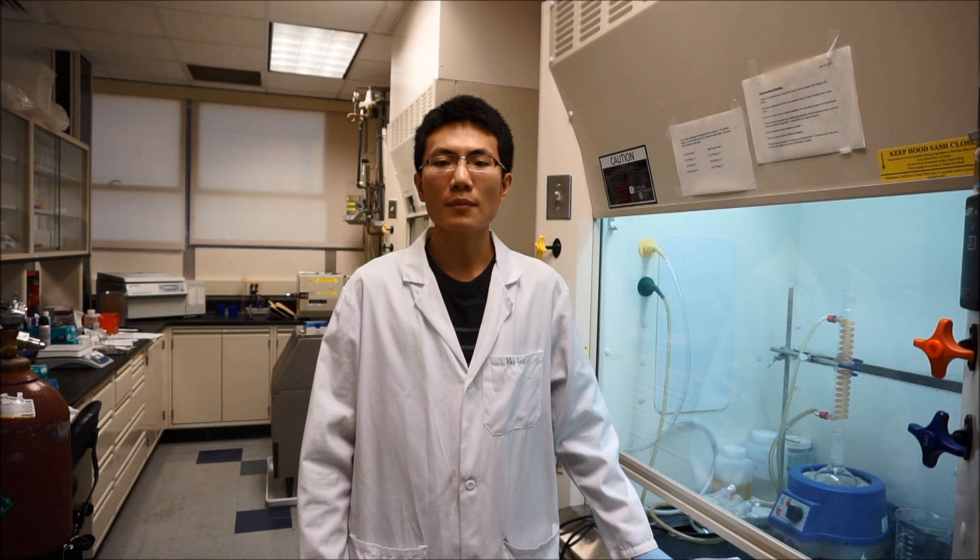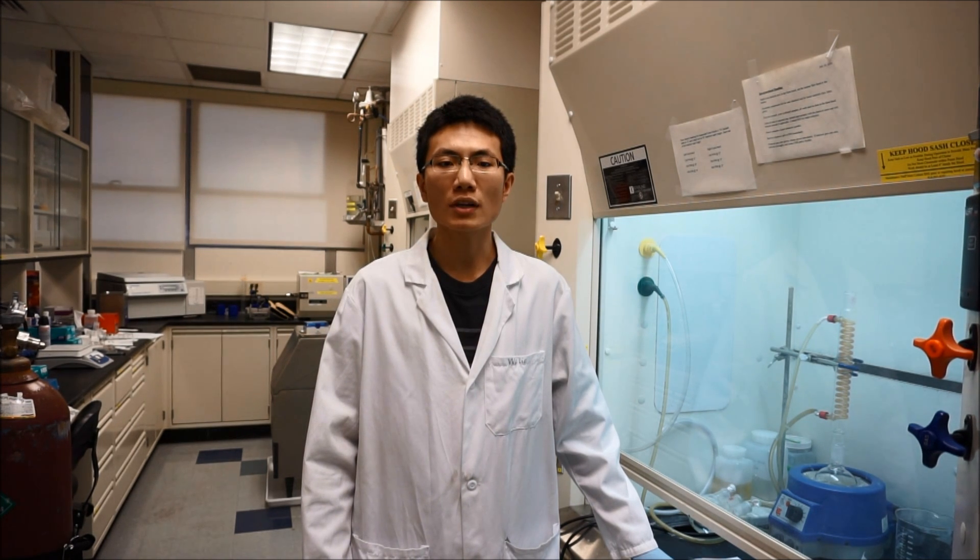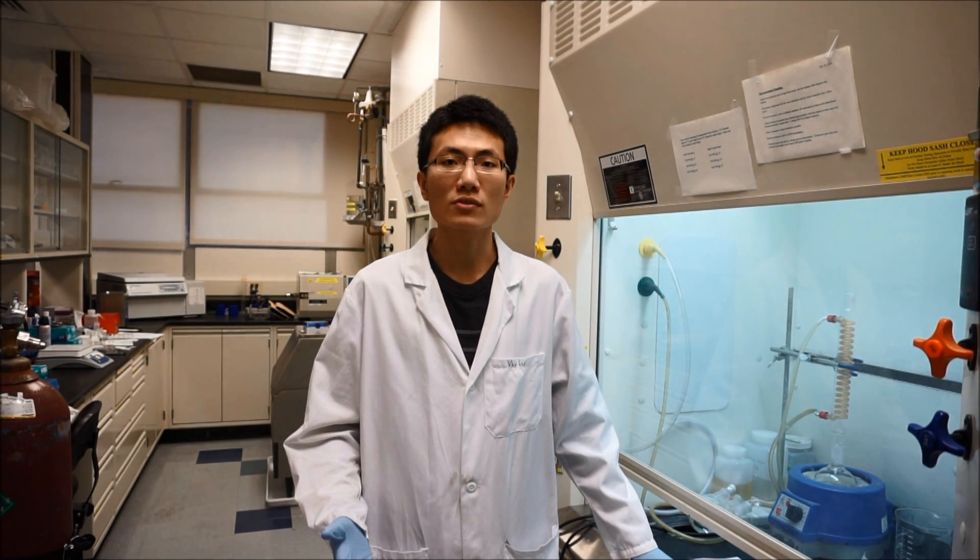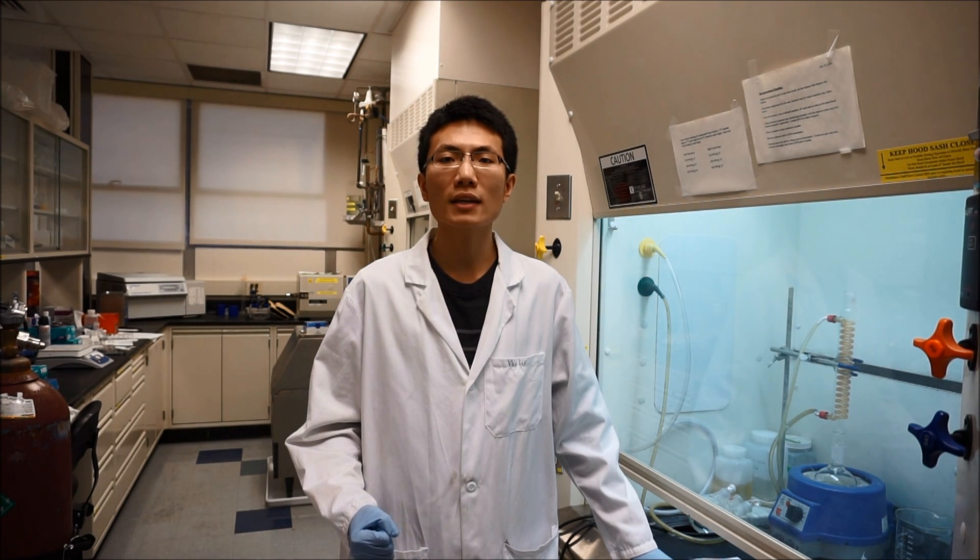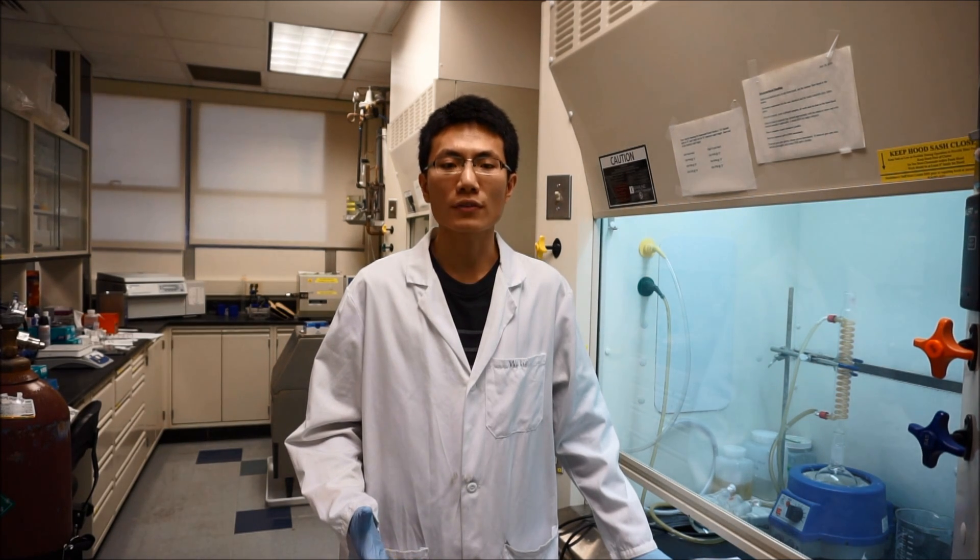Hello, my name is Wu-Lin Yang. I'm a senior PhD student from Dr. Bruce Logan's group here at Pennsylvania State University. Today I will introduce a new way of making active carbon air cathode for microbial fuel cells using a phase inversion method.